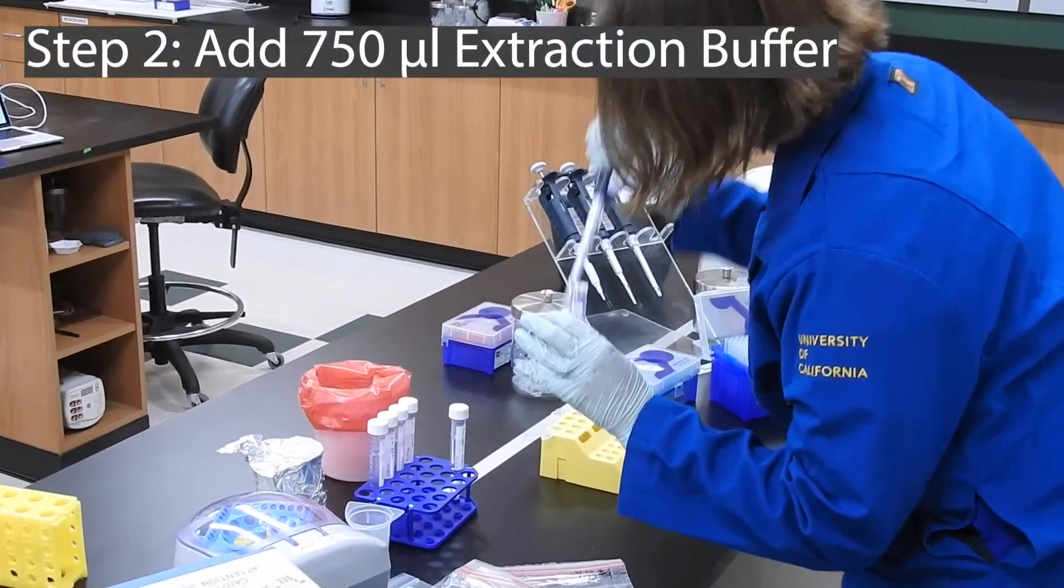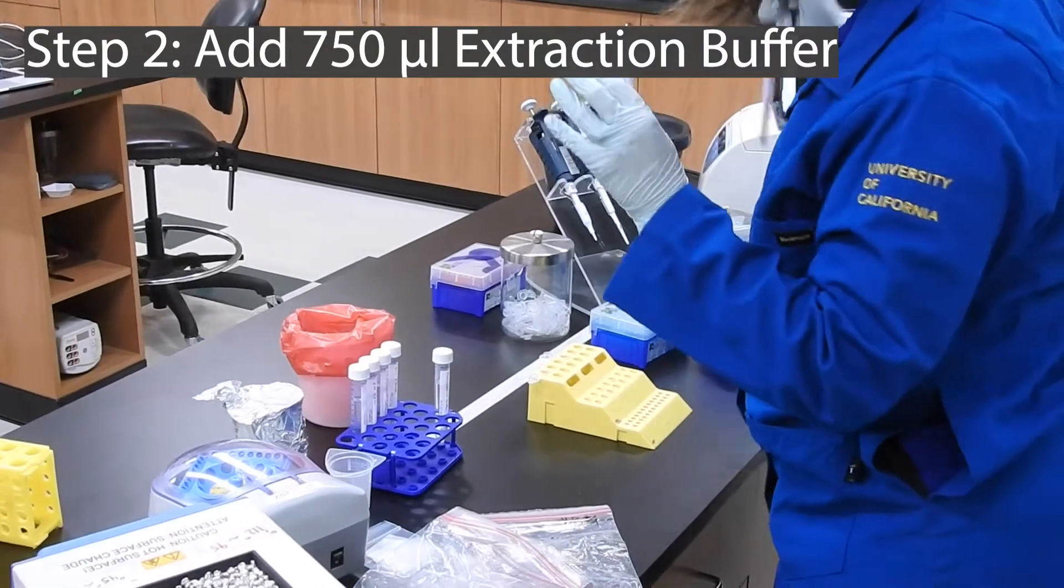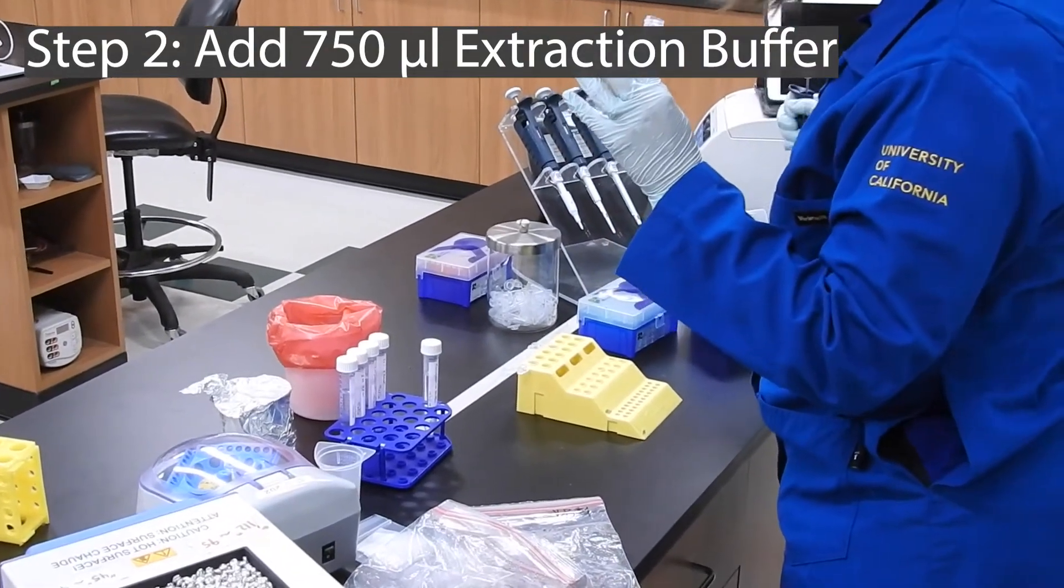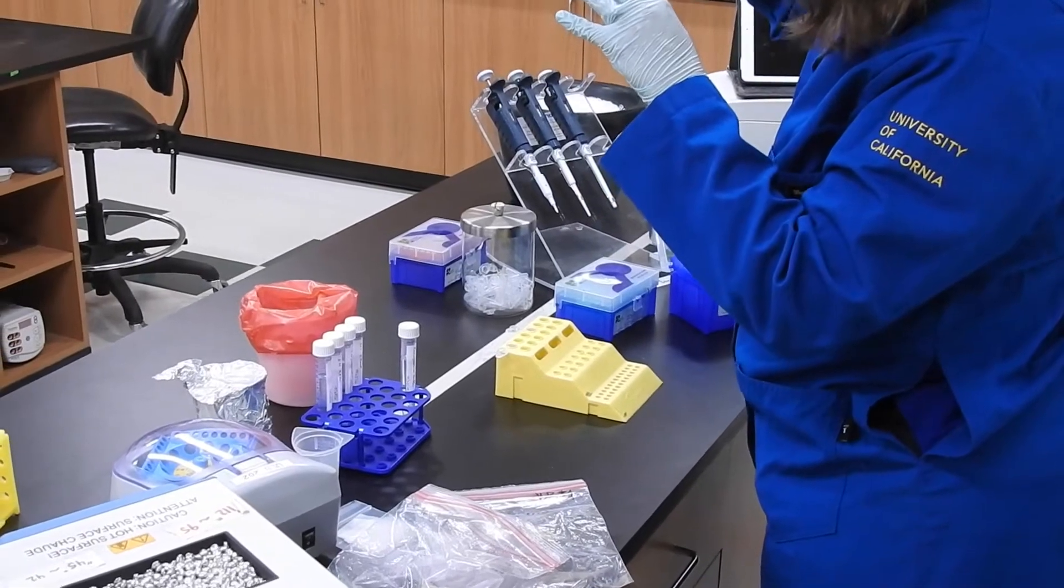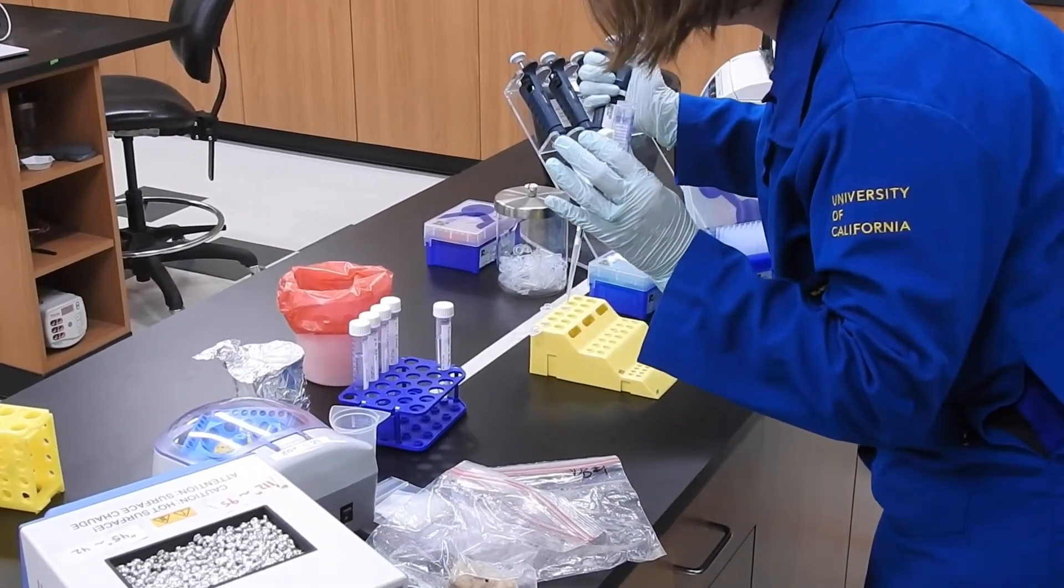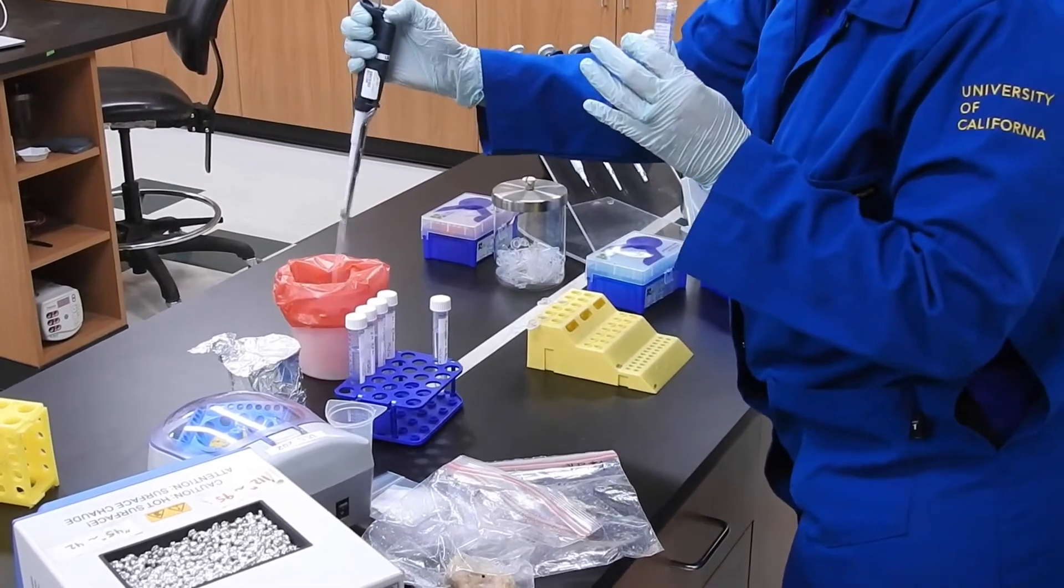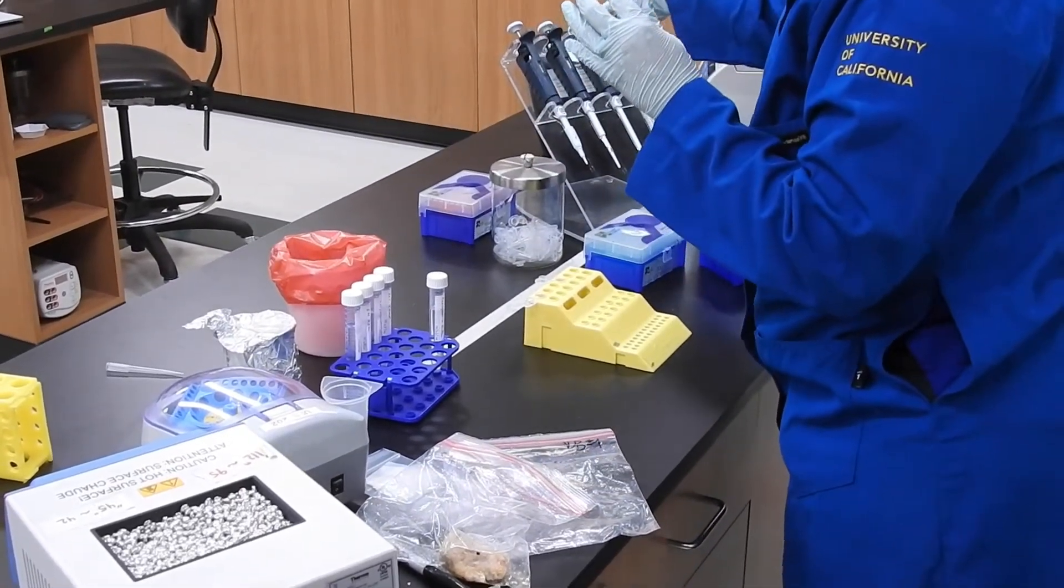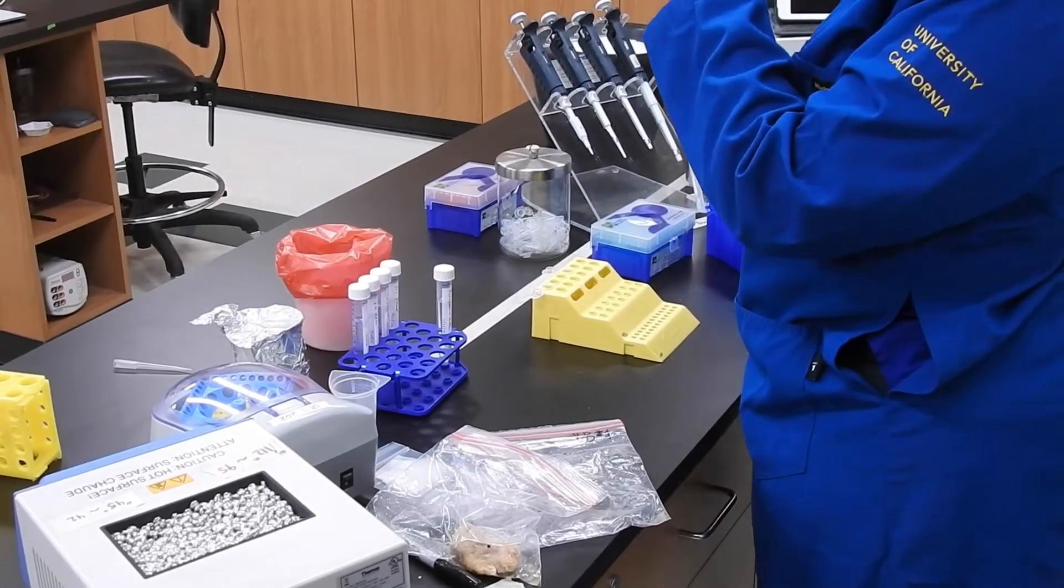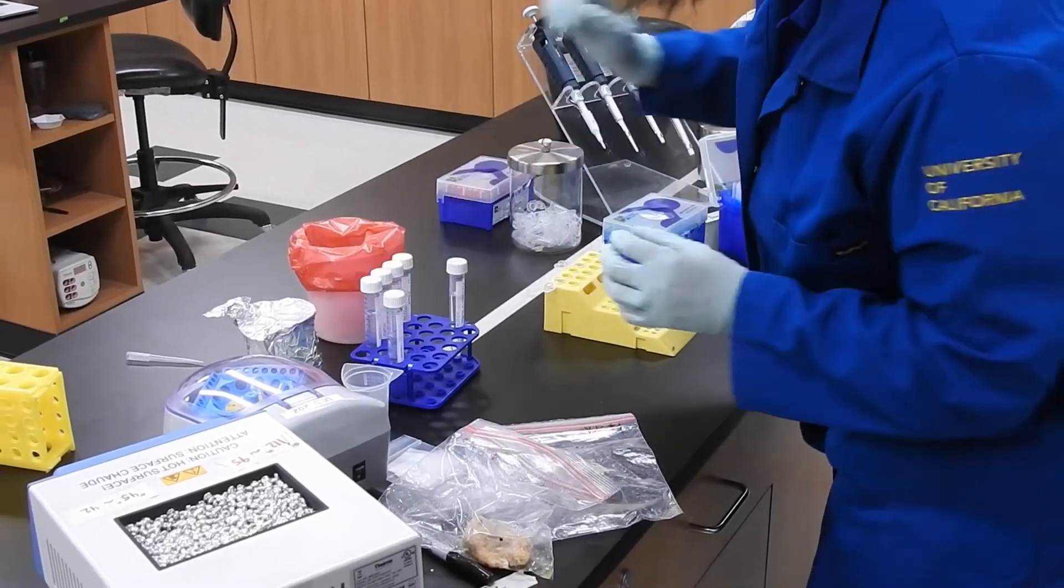I'm going to be very careful not to cross contaminate my fish with each other, because the whole point is you want to figure out what fish number one is and what fish number two is. And if I accidentally mix some together while I'm getting their DNA out, that's going to ruin the whole point.